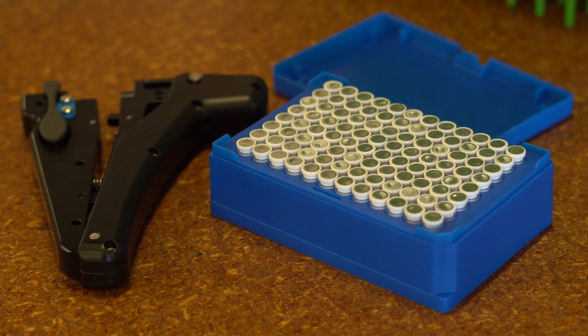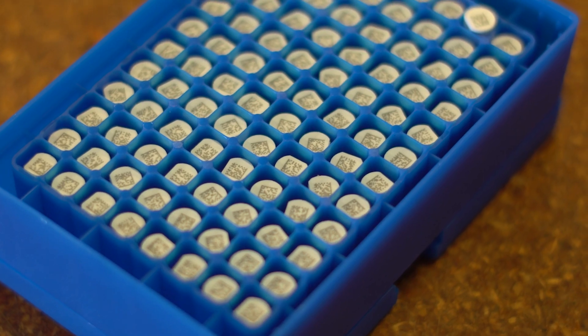The TSU comes equipped with 96 vials in each tray. Each vial has its own unique 2D barcode.